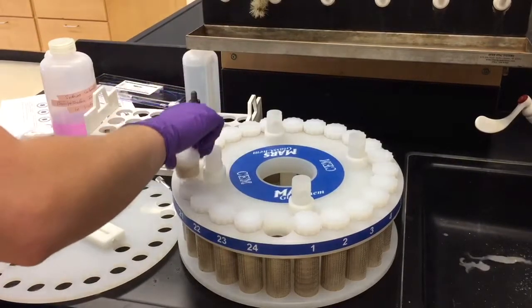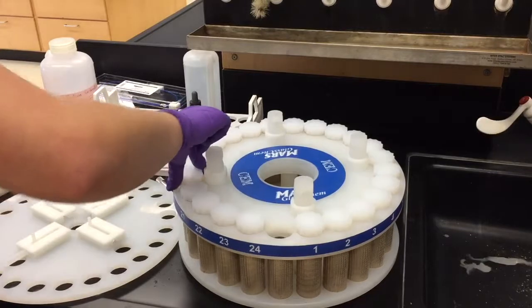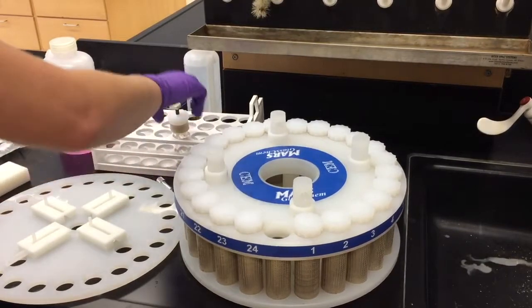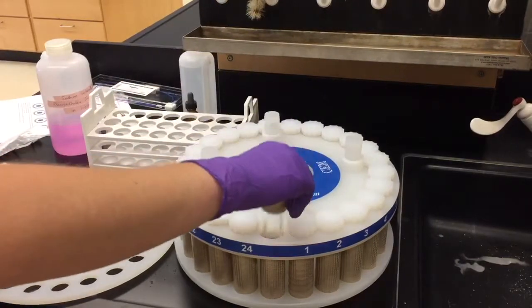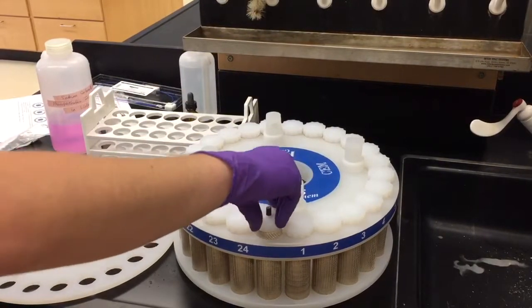Place the control vessel into the sleeve that does not have a number. Make sure that the vessel goes all the way inside the carousel. Be careful in placing the vessels because the labels may not line up with the vessels as the number gets higher.